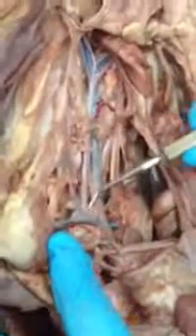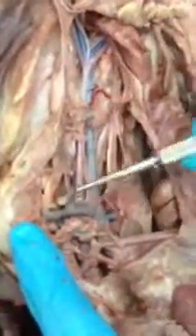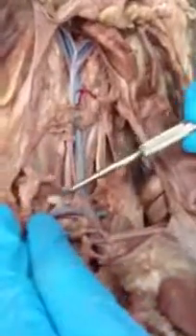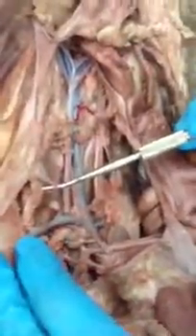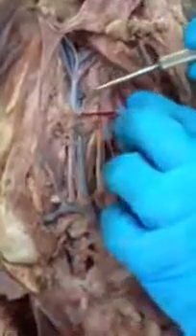Major branch point here. Okay, so we have the renal vein, so draining the kidney and coming into the inferior vena cava, so renal vein. This vein right here is a gonadal vein. And then if we follow that inferior vena cava, we can see down here we have the common iliac veins.